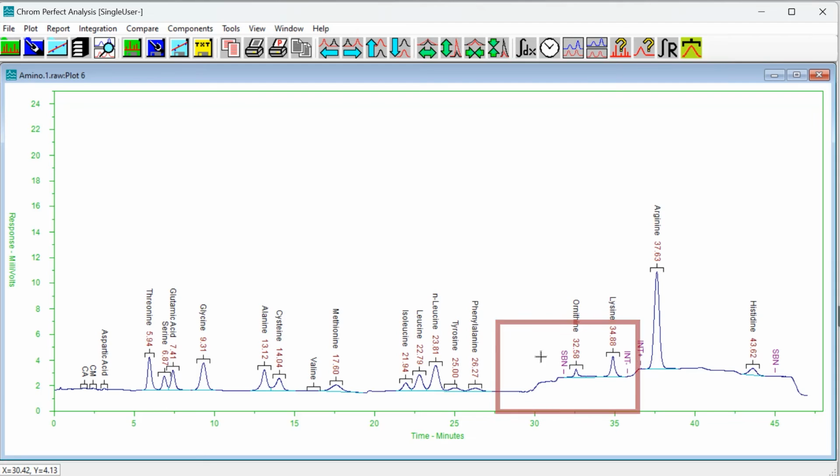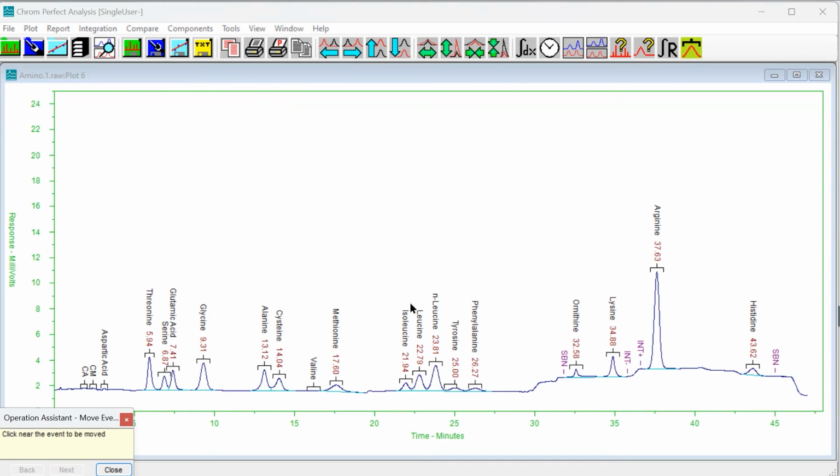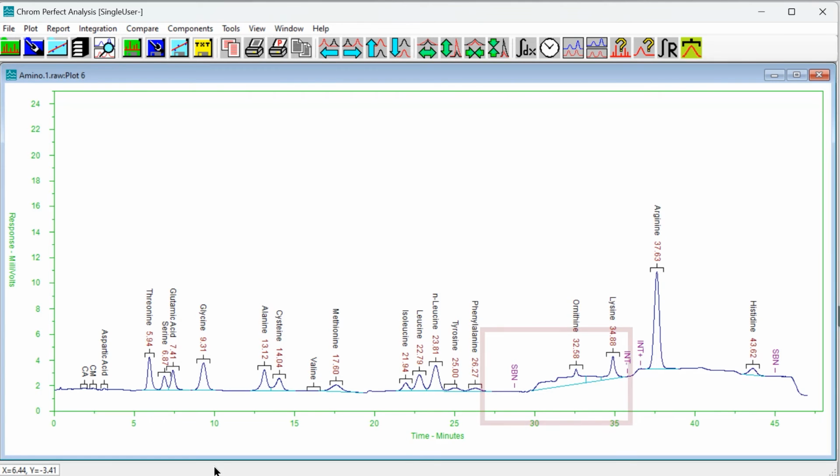our problem appears to have been resolved. But has it? We have irreversibly changed the results of all older files that use this method. If there has been any retention time shifts from run to run, our new event might cause incorrect results due to a badly drawn baseline. Additionally, all future files that we acquire using our new amino method will now show the same timed event at the same spot in the run. If this is problematic, then we might need to move or delete our timed event, which means we are right back to where we started if we ever want to open this specific file.